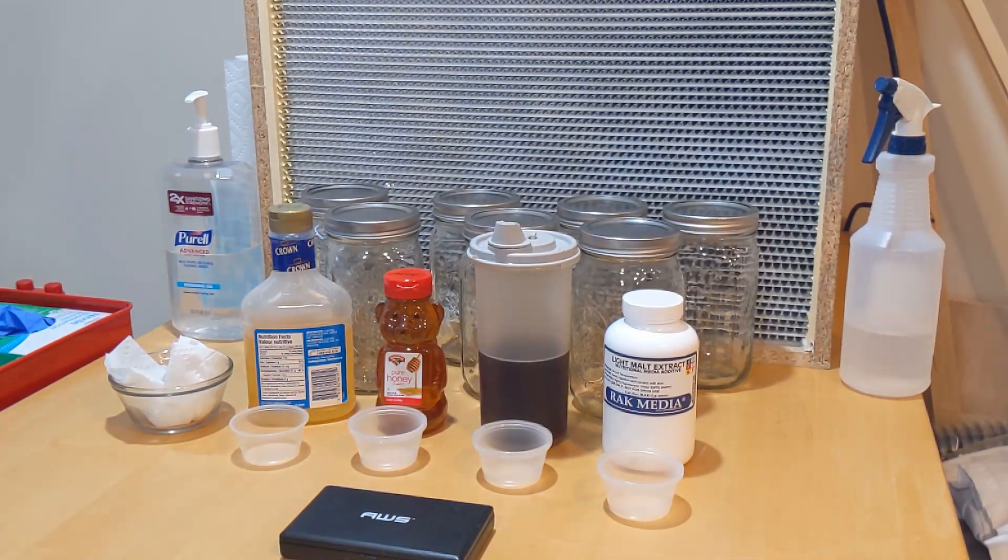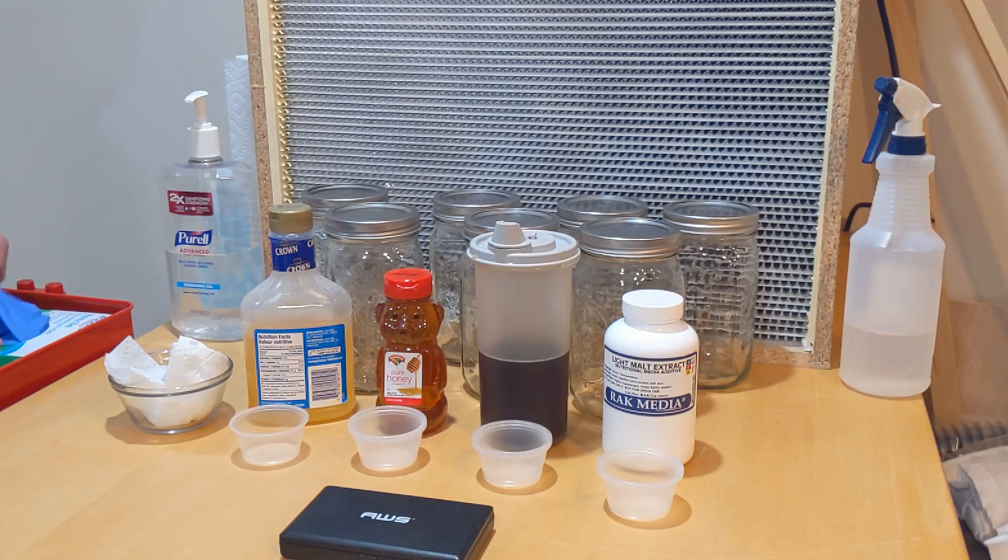Hello everybody, Psyche here. Today I just want to go over a couple of different liquid culture recipes.